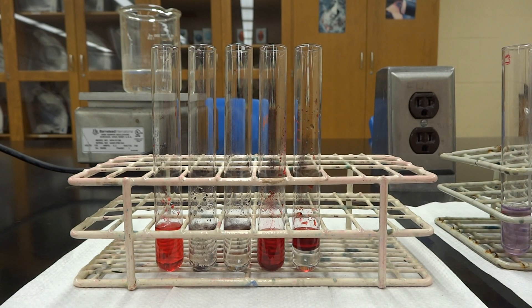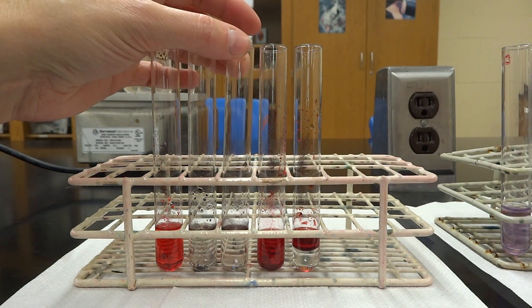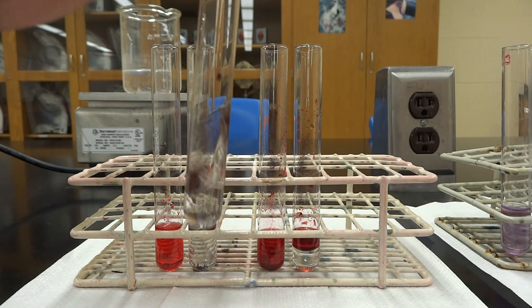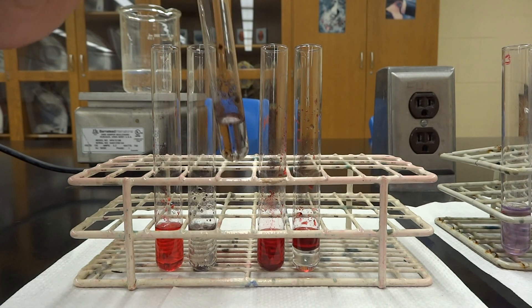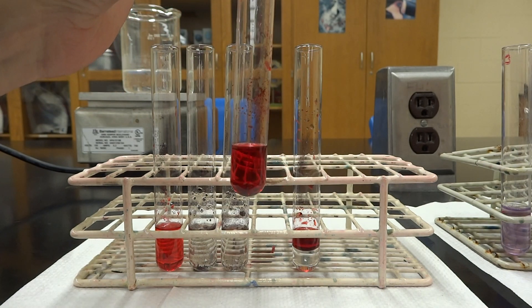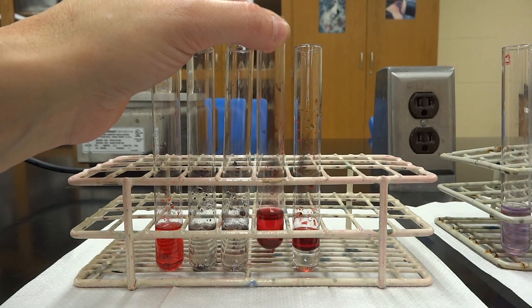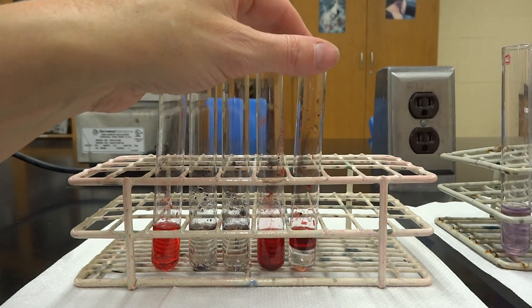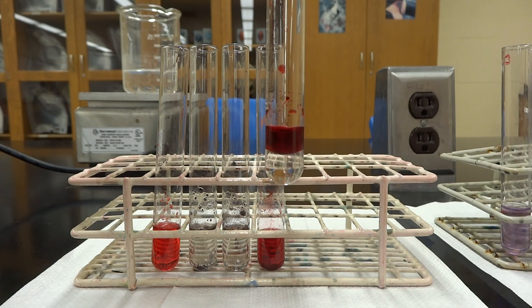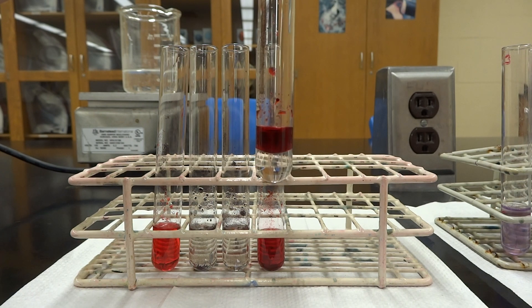We use that to compare for our other three unknowns. The unknowns for this were a sucrose solution, which is sugar — not a lipid — so it did not dissolve and does not have lipids in it. Number four is oil, which is a hydrophobic substance, so the Sudan IV dissolves in it. And then the last one is half water and half oil.